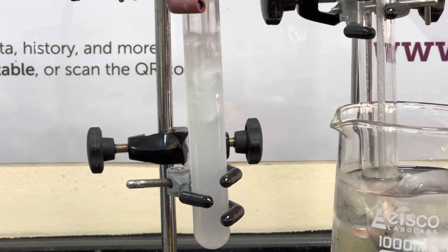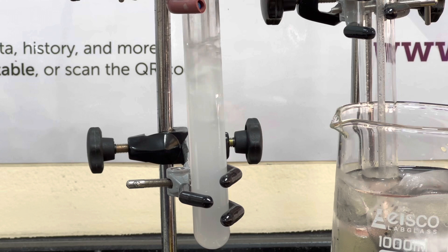Lime water turns milky, cloudy white, as you can see. This part of the demonstration takes place very quickly, so it's quite successful. And the precipitate, which is the white solid that forms, can actually settle at the bottom once you stop the gases from being sucked through the apparatus.